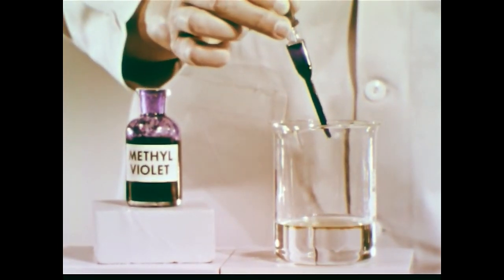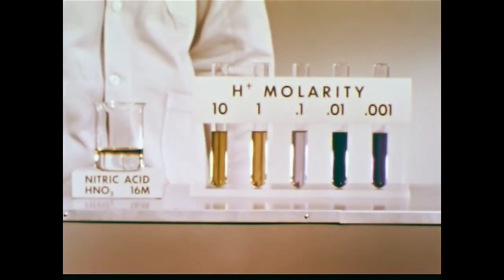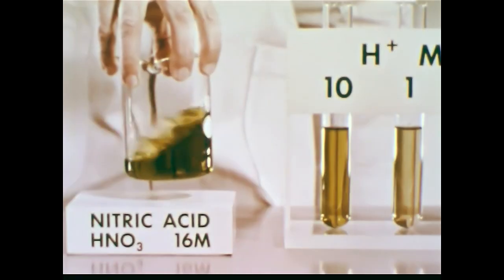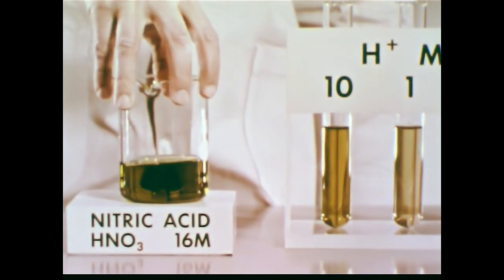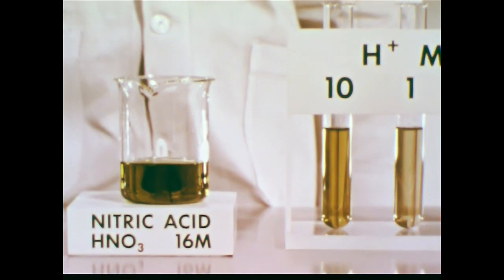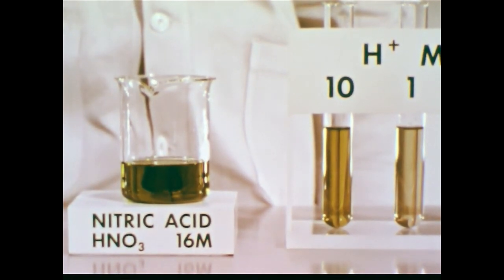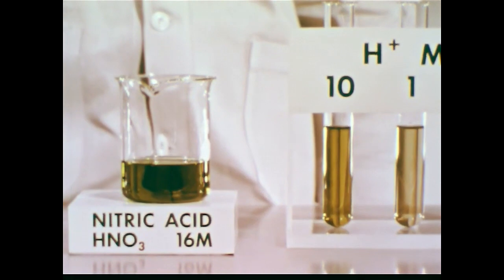When methyl violet is placed in 16 molar nitric acid, the color indicates a very high hydrogen ion concentration, at least 10 molar. Thus, nitric acid is a very strong acid — it readily donates a proton to a base.